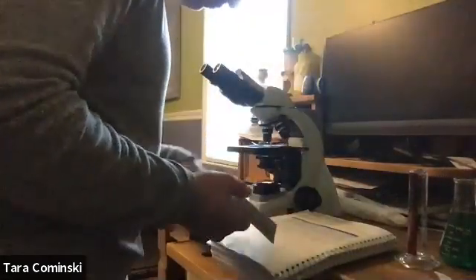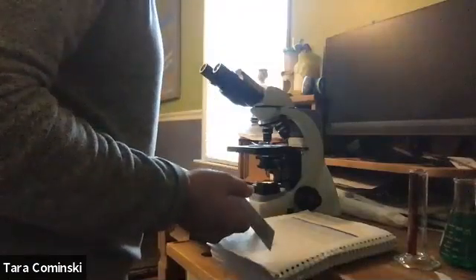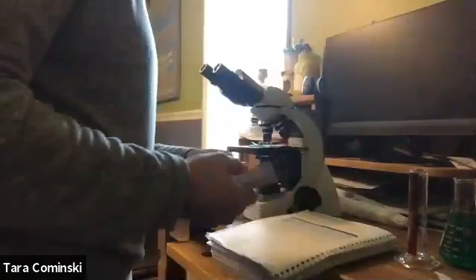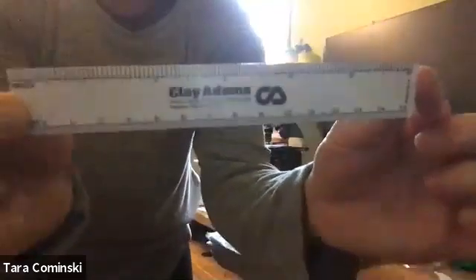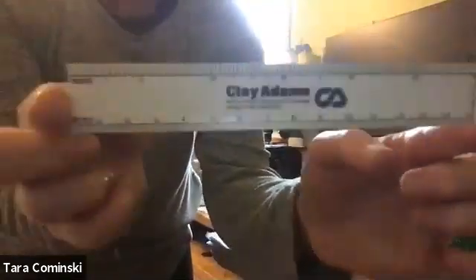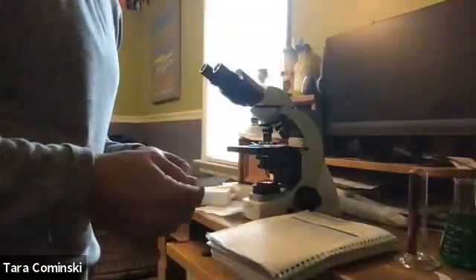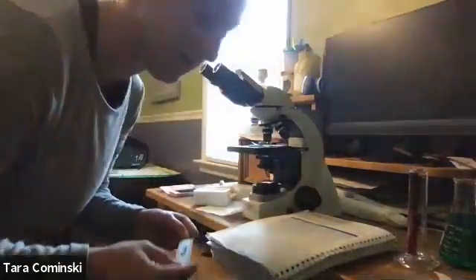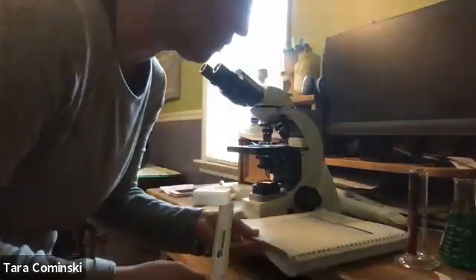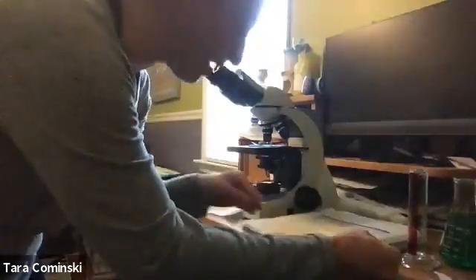Now it asks you to do more conversions in number 1, so make those additional conversions. All you really need to know is that this is 15 centimeters in its entirety. Number 2 asks to measure the diameter of this circle. I'm going to measure it and tell you the measurement, and then you can do those conversions on your own. Again, pause it, do whatever you need.